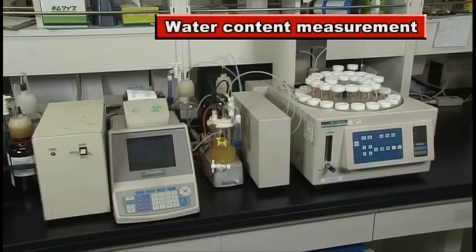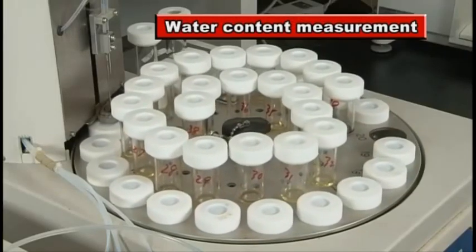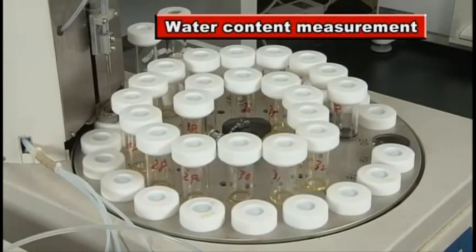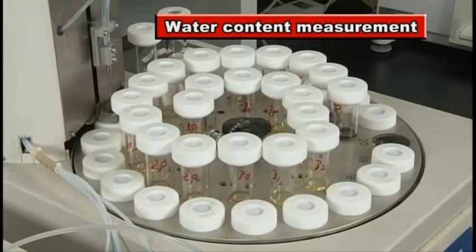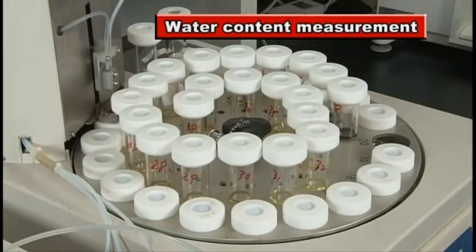Water content measurement: water in fuel oil causes poor ignition, poor combustion, and corrosion.